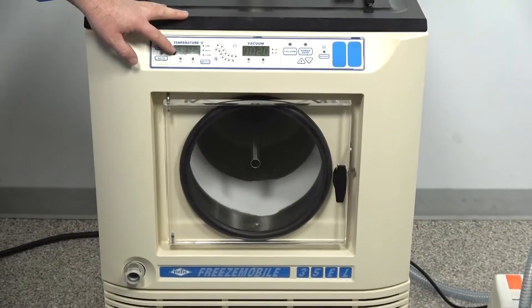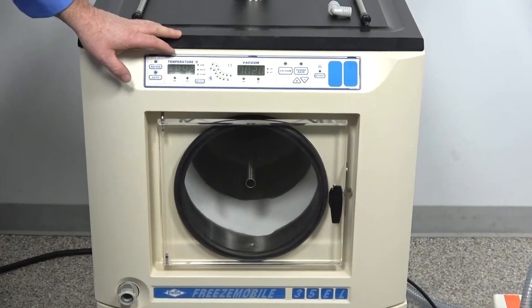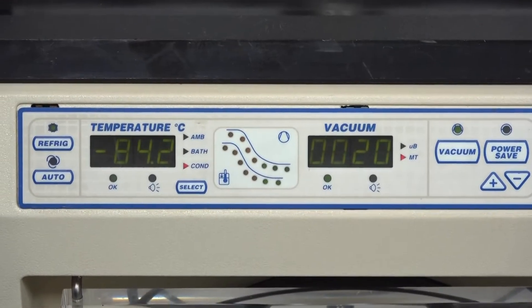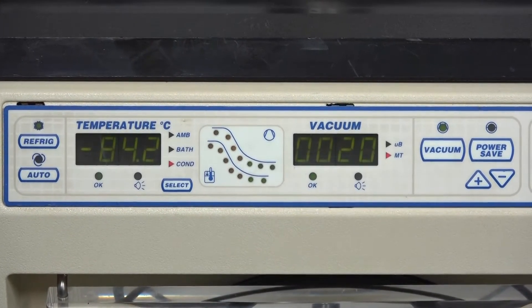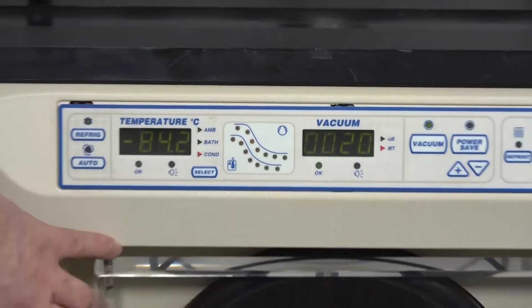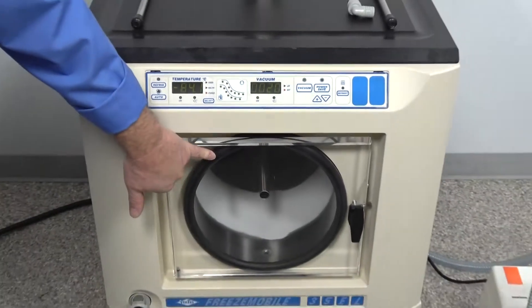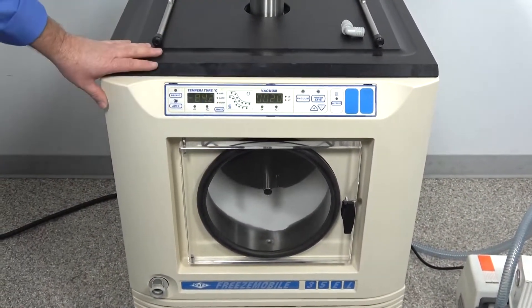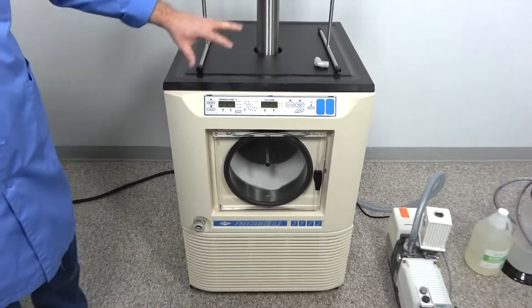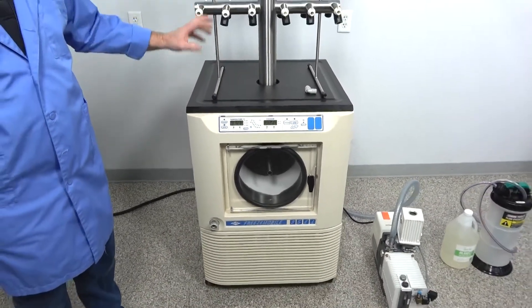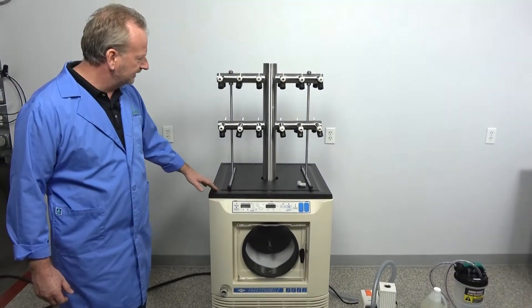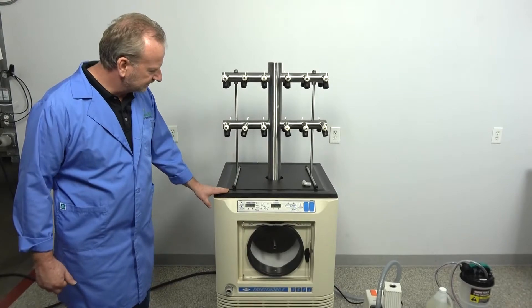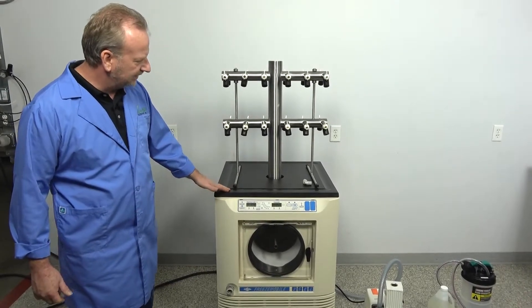You can see we're negative 84 degrees. We're also pulling down to 20 millitorr right now. And I think we put a brand new door on here, brand new door seal and we've repainted the whole thing and we've gone through the back end, re-insulated, verified the compressors and did all our testing and got it all working back to manufacturer specifications. And it's a nice running unit.